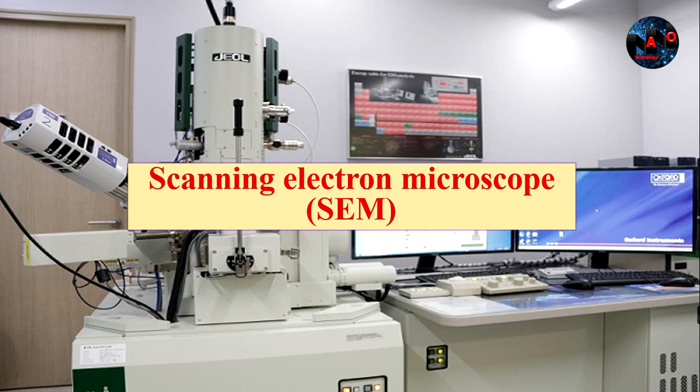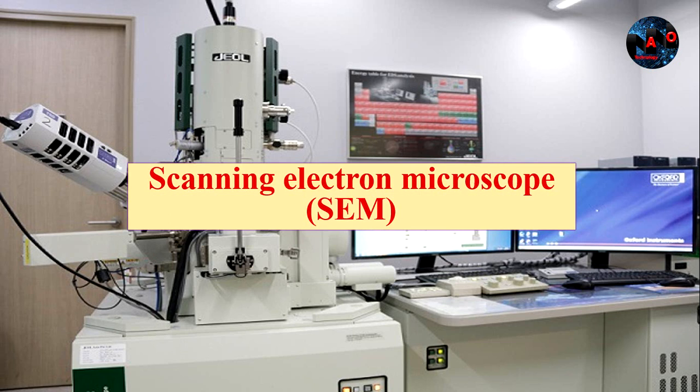They are designed primarily to examine material surfaces, like a reflection light microscope.